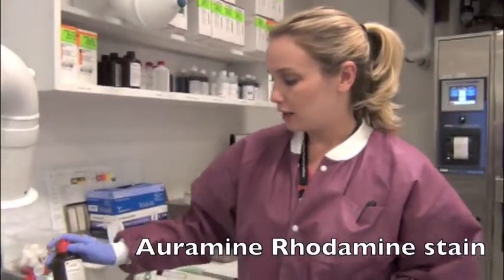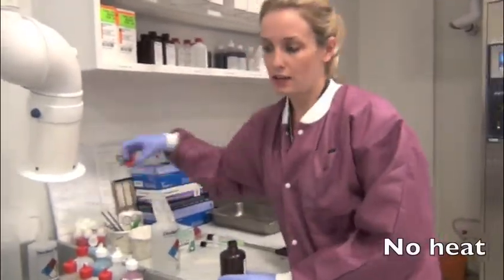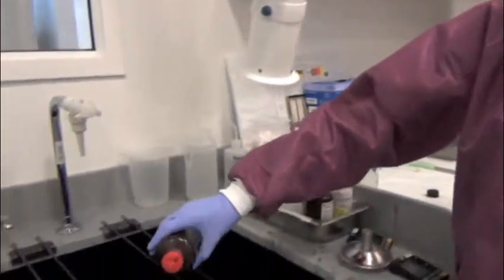Next, we'll go over the auramine O stain. Auramine O is a fluorescent stain. We don't apply any heat when we're using auramine O. Instead, we just increase our staining time. This stains for 15 minutes.